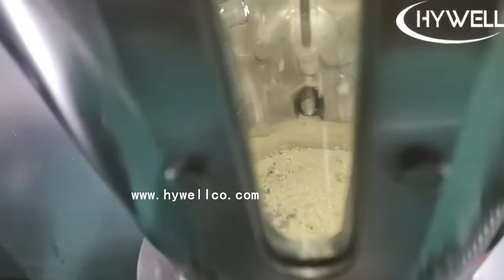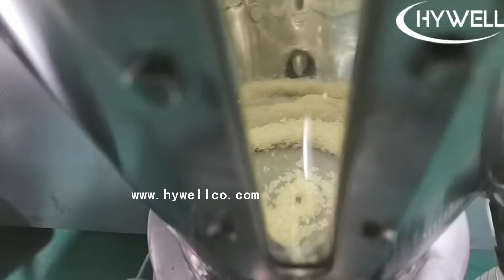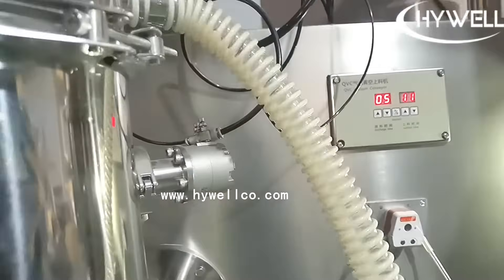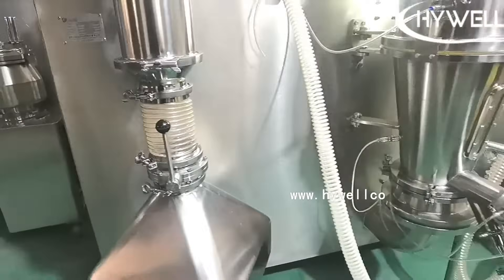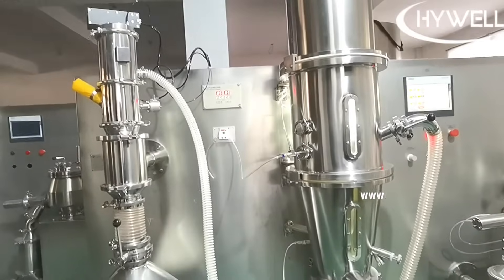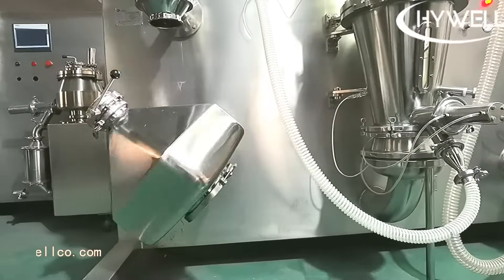This pharmaceutical granulation equipment ensures there is no cross contamination. The solid oral dosage granulator combines mixing, granulation, and drying processes to ensure continuous and stable production. The granulation drying production line can highly increase the yield of finished products. The vacuum conveying device and lifting turnover discharging system greatly decrease labor intensity and avoid dust pollution, saving on the cost of labor.